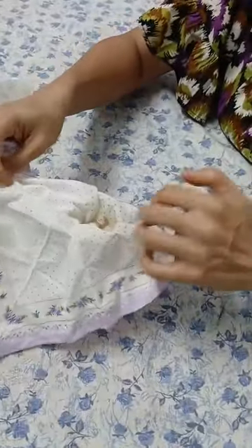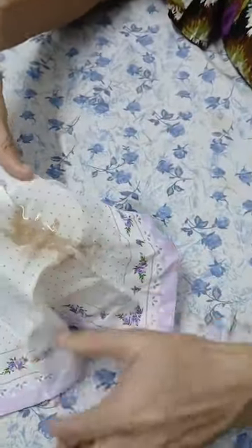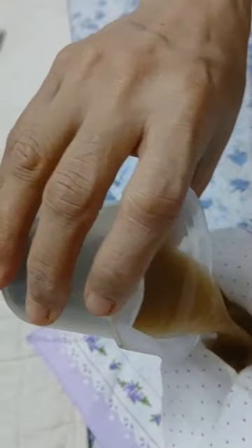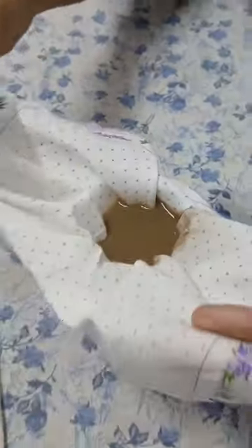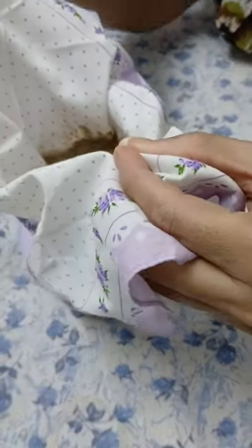The insoluble mud particles will be settling on the handkerchief, the porous cloth material, and this is called the residue. I will again take the second step. Now I have poured the whole of it.